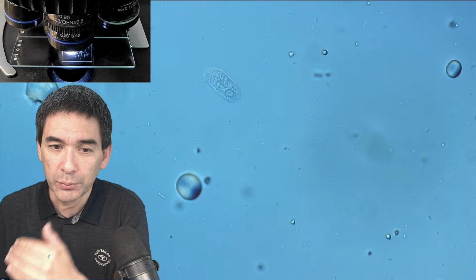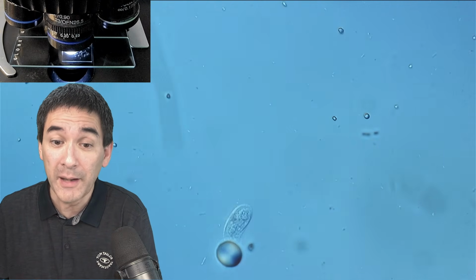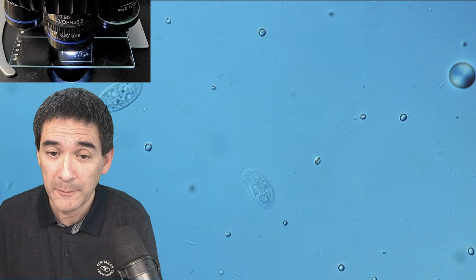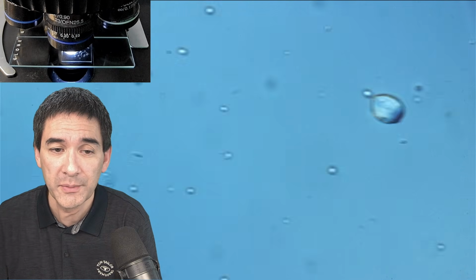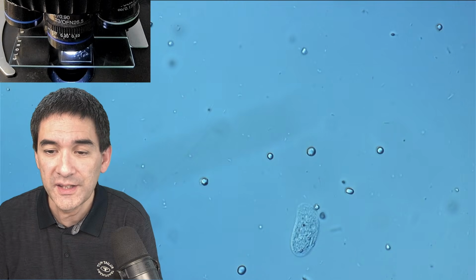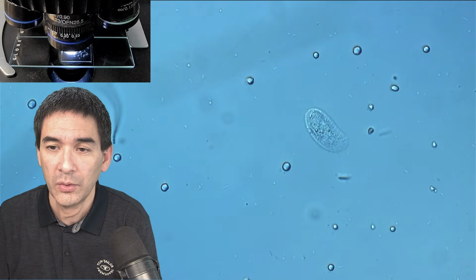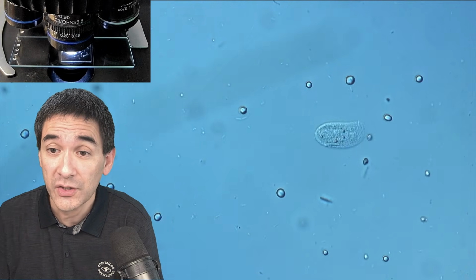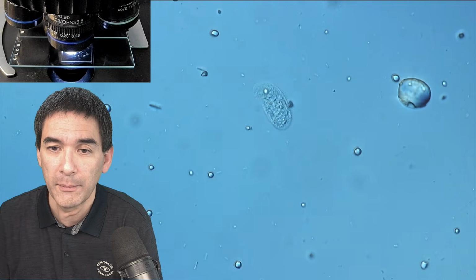So there's a progression. And what we see over here, in this specific water sample, is that at least the biodiversity of those ciliates is not really high. I only found those 2 different types. But there are other water samples where I had many more. So again, this is trial and error. You cannot grow organisms that are not even present in the first place. So a lot of the success depends on the quality of the water sample.